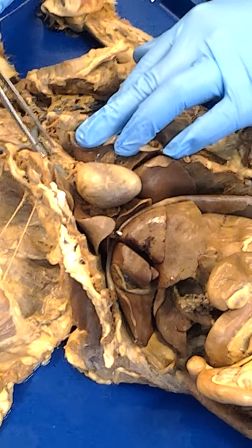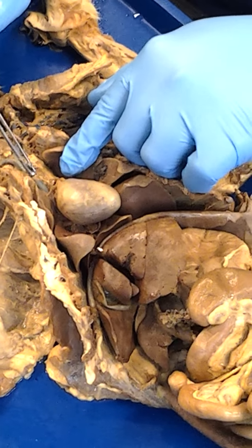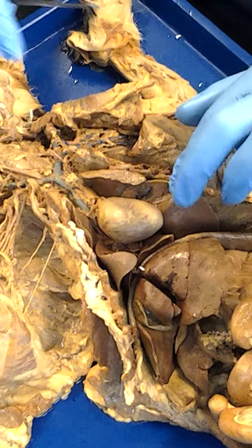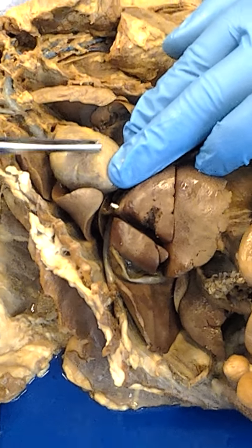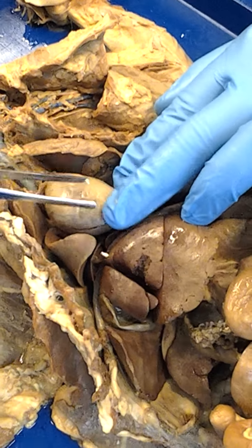And of course, there's a blood vessel that comes into the superior vena cava right here, and this of course is the azygous vein. So that's what that is. That's the azygous vein. Notice that there's a blood vessel here on the top surface of the heart right there, and that of course is going to be the great cardiac vein and the anterior interventricular artery. So we're good on that.